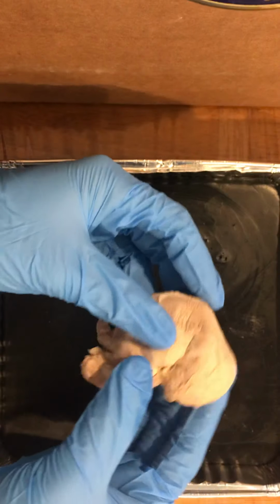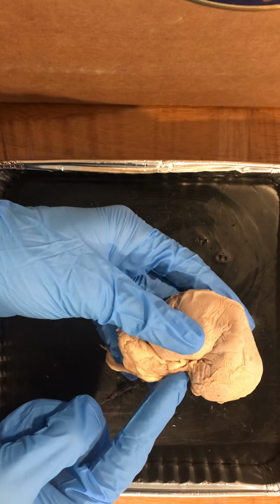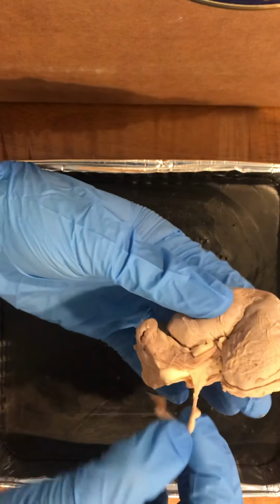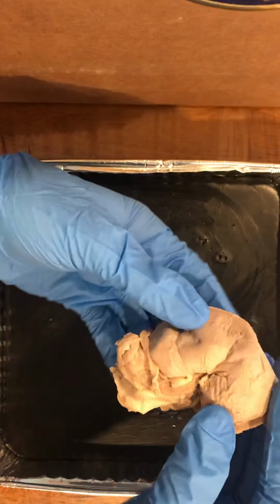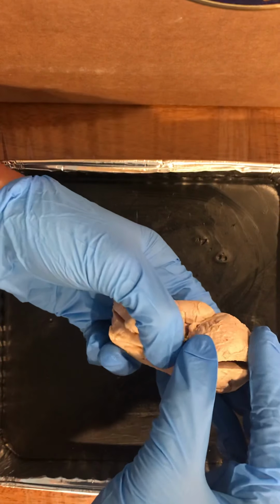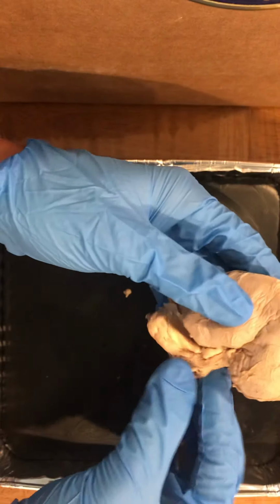There wasn't any adipose tissue really on my kidney, so I had nothing to remove during my dissection. The hilus is located right here, and it is an indentation on the kidney where blood vessels enter and exit. I wasn't really able to see the renal artery or renal vein from the outside of my kidney, but I will get to that later. There wasn't really any more adipose tissue on the hilum either for me to remove because I was able to see my ureter right here.